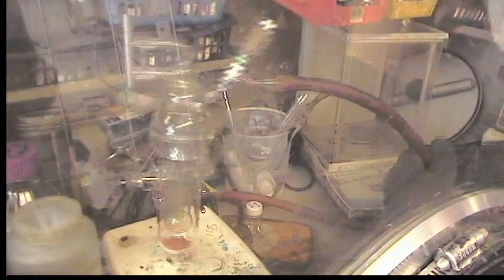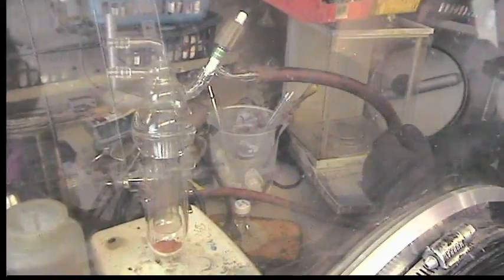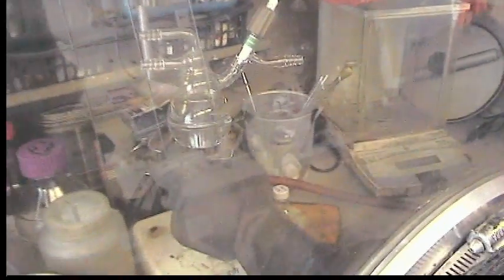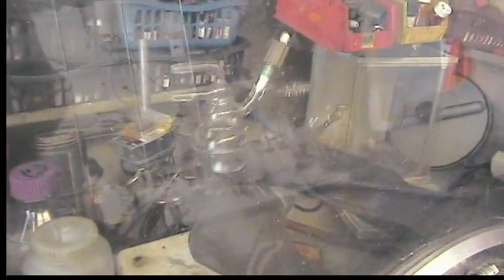Make sure you close it tightly. Are you going to wrap it in aluminum foil now? Yeah, so as soon as it comes out of the glove box, we will wrap it in aluminum foil.